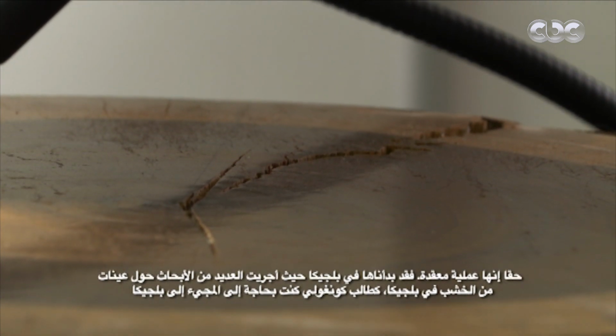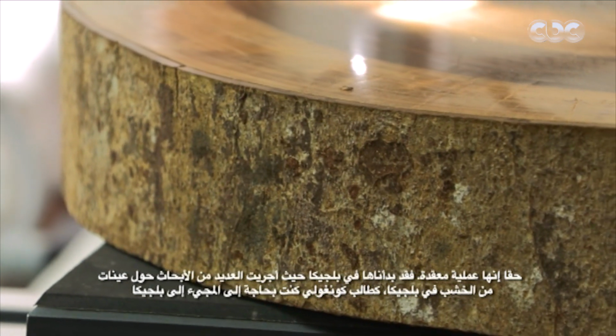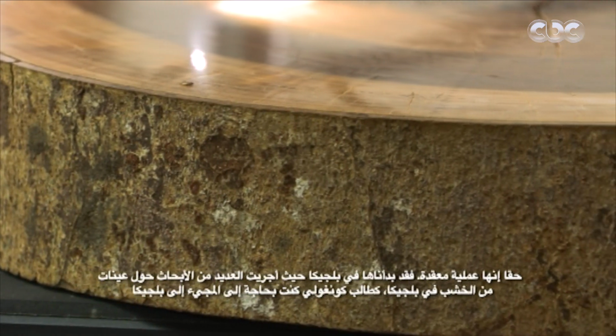We started doing all that in Belgium. We took a lot of samples to Belgium, and our Congolese PhD students needed to come to Belgium to be able to study the wood. But now we decided to install a laboratory here in the middle of the forest, so that we can study forest ecology and wood ecology within the rainforest, and more Congolese students can take advantage of the setup.